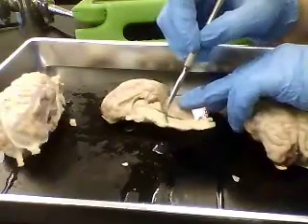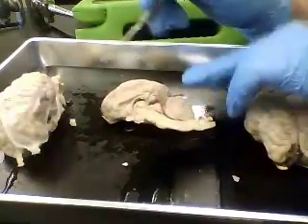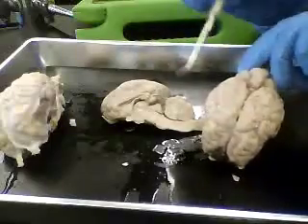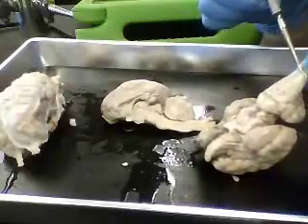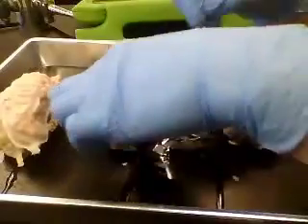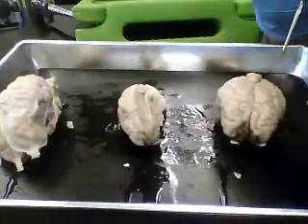We also have the pons, the medulla, spinal cord. These are all cut through. There are two hemispheres in the cerebrum, but the brain stem is singular, so it has to be cut through when we're looking at this sagittal section. So those are the important structures that you may see on the sheep brain dissection.